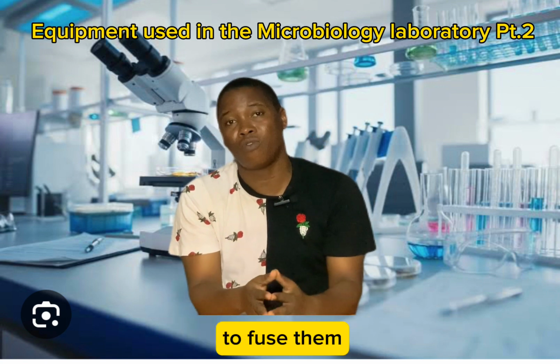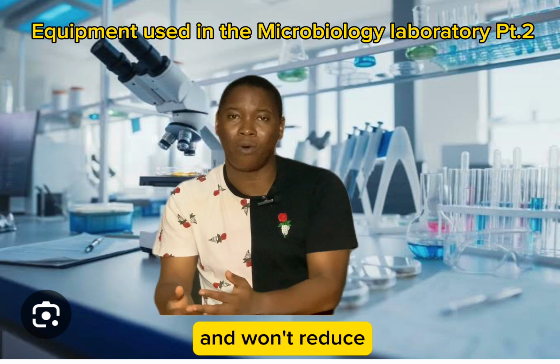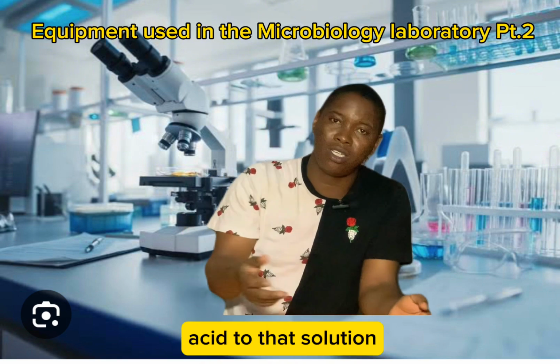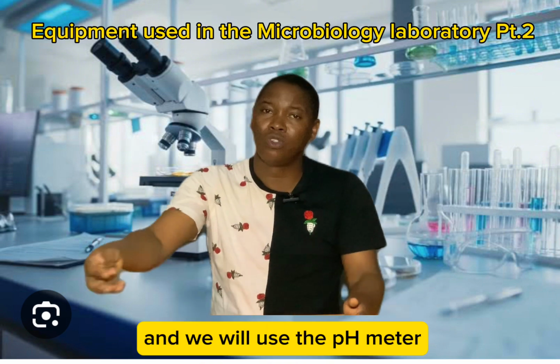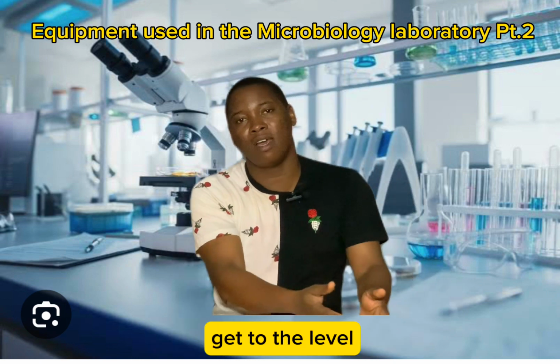Now, many times too, we fit use am to adjust pH. Let's say our pH dey for particular level and we wan reduce am, we wan make am more acidic. We go dey add acid to that solution, and we go dey use the pH meter to dey check, to adjust till e get to the level wey we want make.